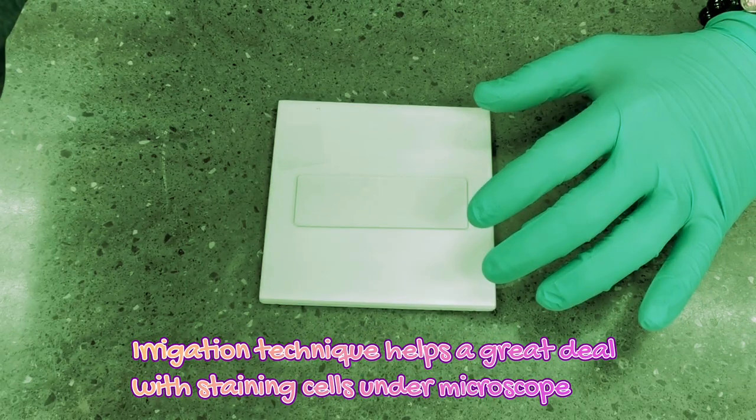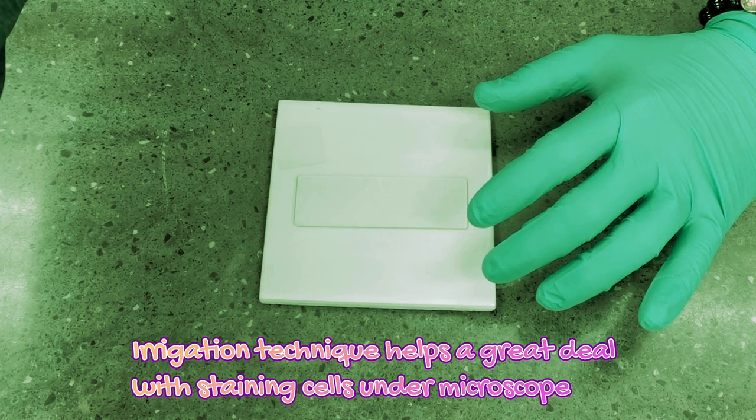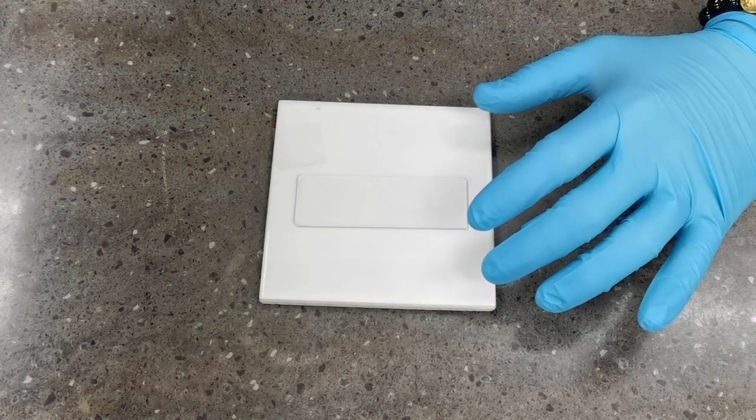Cells may need to be stained so that we can view them well under the microscope. The irrigation technique helps to get the staining dye evenly distributed throughout the cells that you want to view.